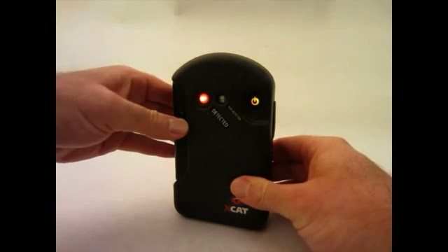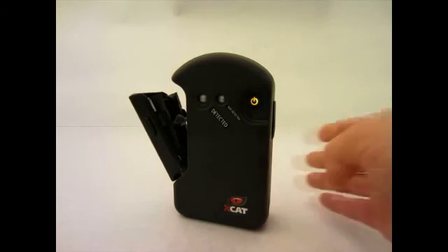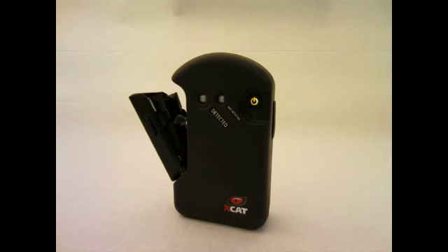Open the door and remove the card immediately after use. Place the card in a plastic bag for disposal. Cards are not reusable. Additionally, there is no cross-contamination between cards and no calibration, so different cards can be used one right after the other.